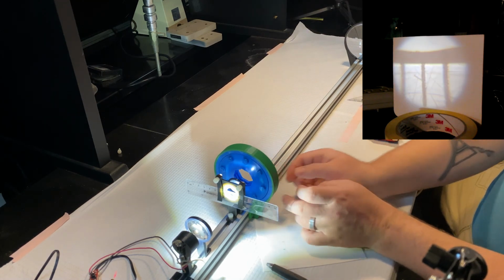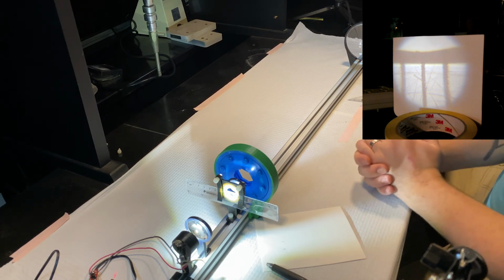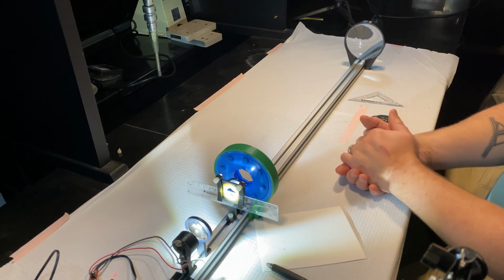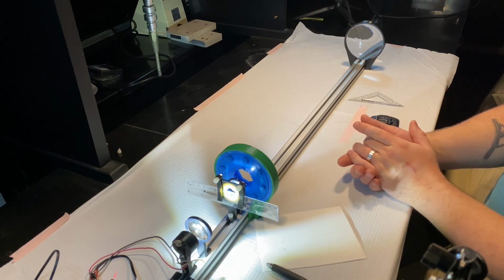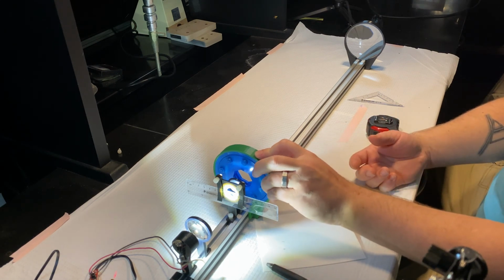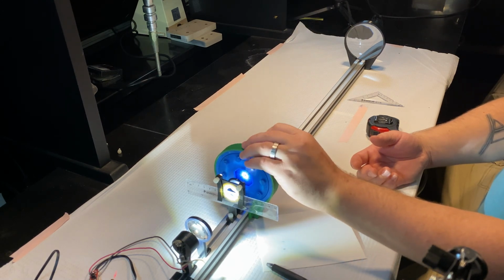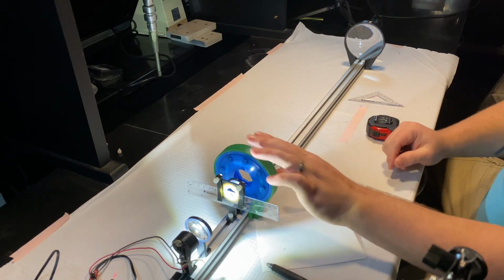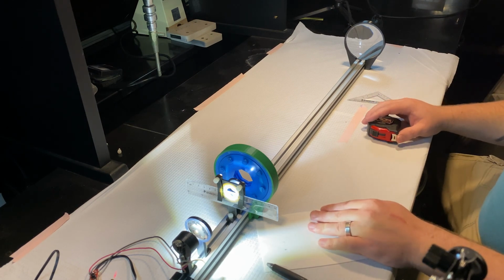So this should tell you the answer to one of your questions on your sheet, that there is a location where the iris dims the intensity but the field of view remains the same. And that location is the back focal plane of our objective. You should be able to reason why that is based on your previous homeworks and your lectures. This is a useful way to dim the intensity of your image without putting any filters whatsoever, just blocking out different parts of the light.